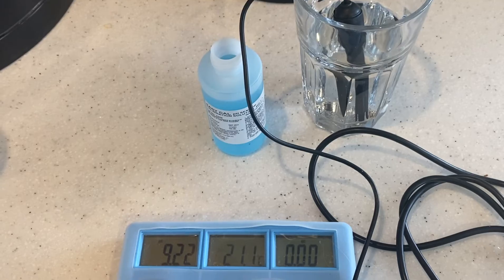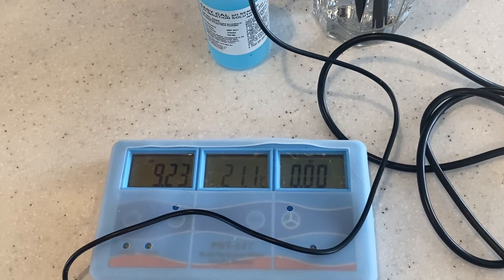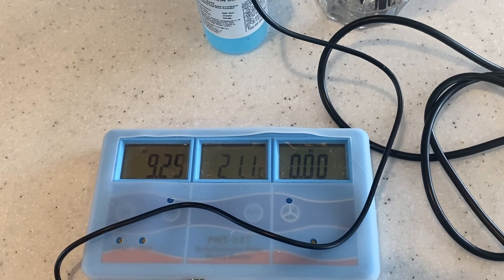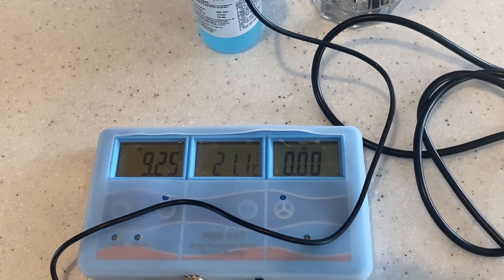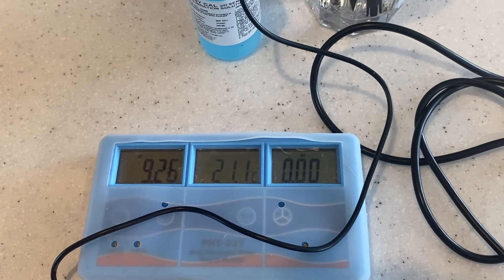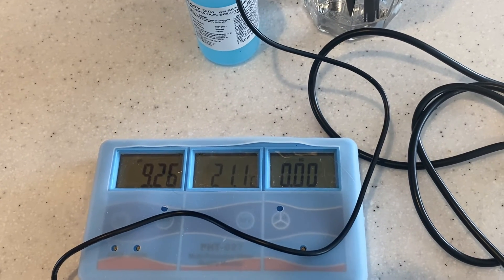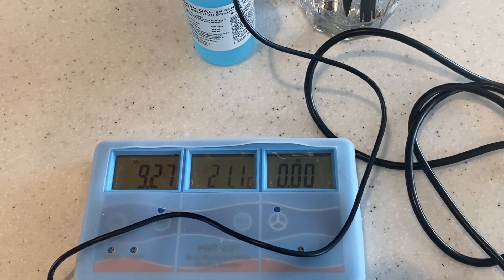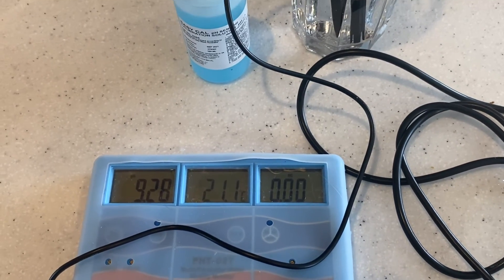So it's definitely not acidic. Using properly calibrated digital testing equipment is always a lot better than hearsay with semi-unsubstantiated testing equipment. Thank you very much.